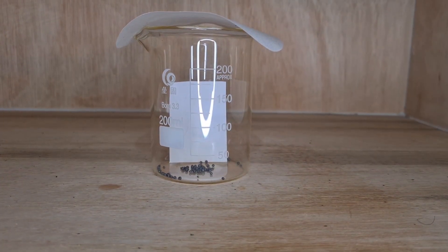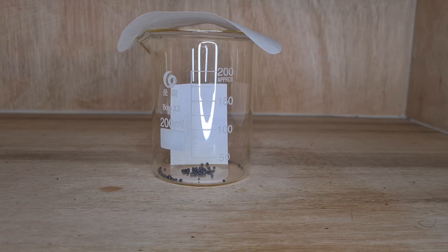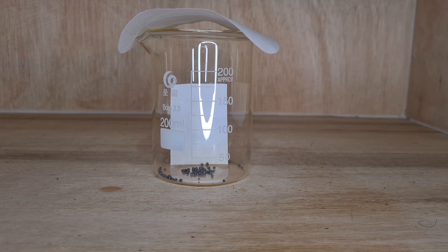So the sound in the background is actually just the fume hood going pretty fast. And from here you can actually hear me talking and it sounds like a rat squeaking because of how fast it is.